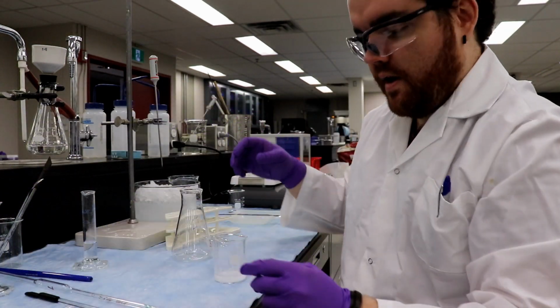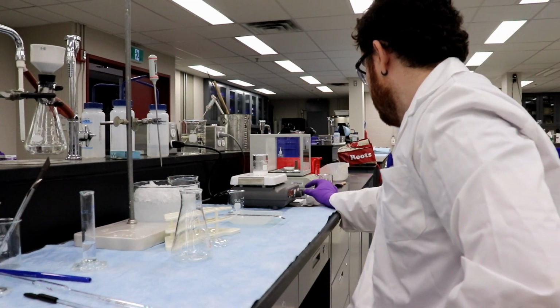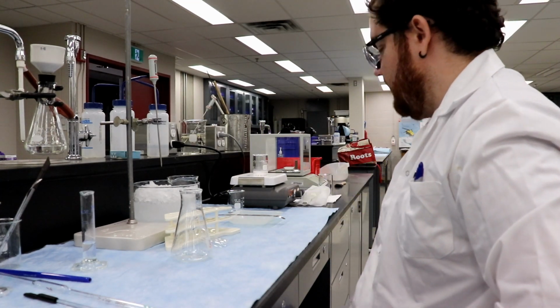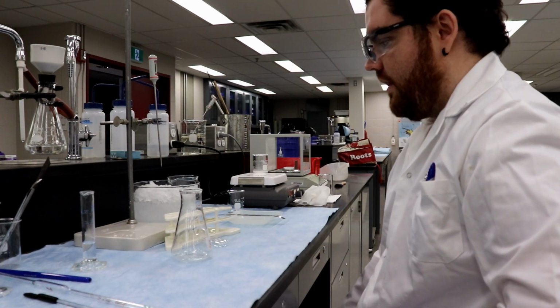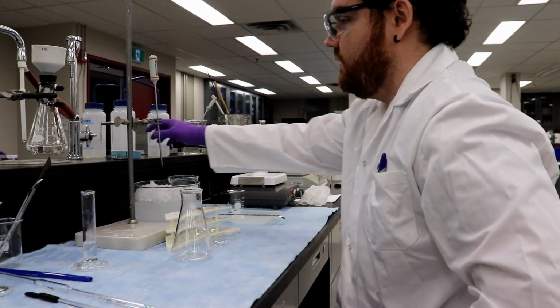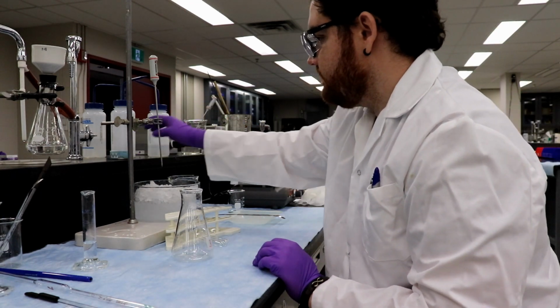That goes off to the side, that goes off to the side. And now this right here goes on there. That's on low. We basically want to get that to boiling. Once that's back to boiling, we then shove it on there and filter that off. So while we're doing that, get some filter paper ready. I already put some in. Perfect.